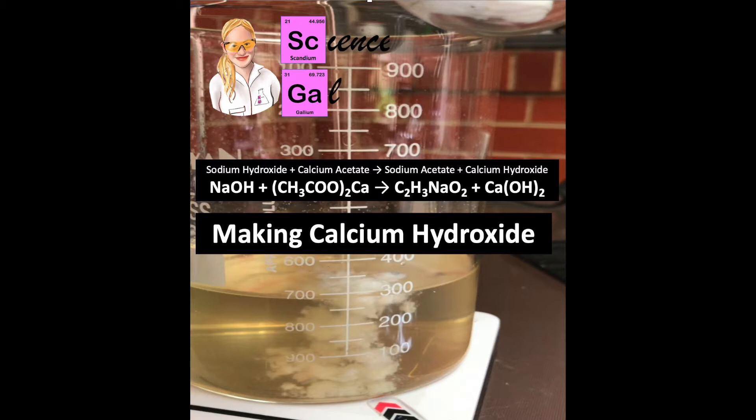The reason I am doing this experiment is because I need the calcium hydroxide to make ammonia, which I will do in a later video.